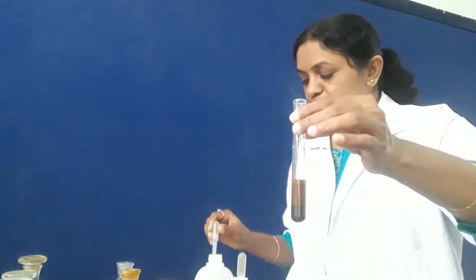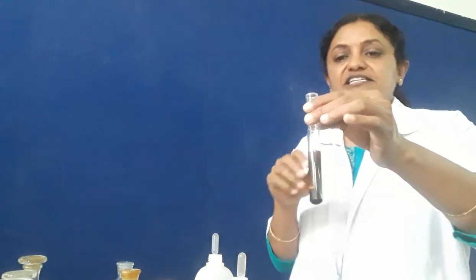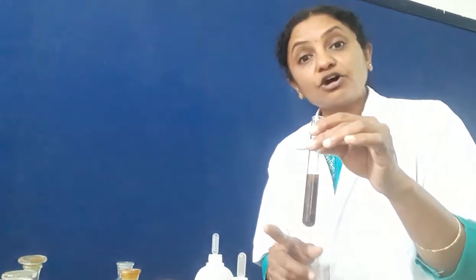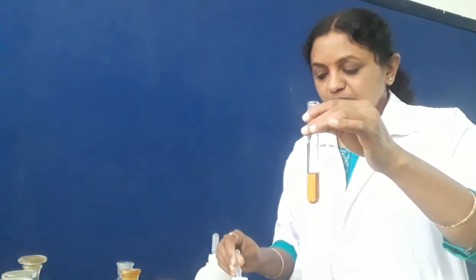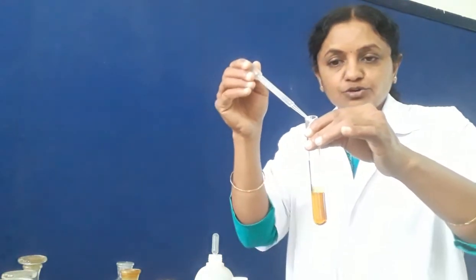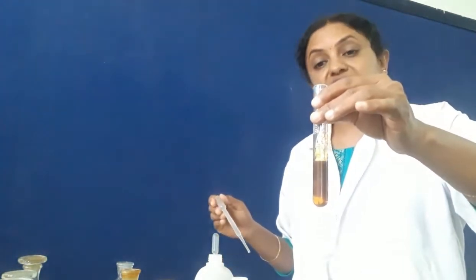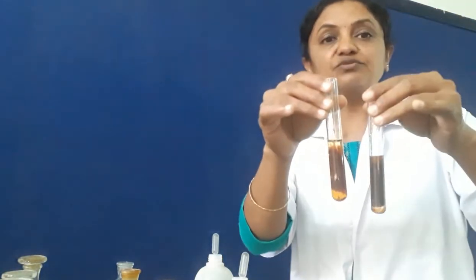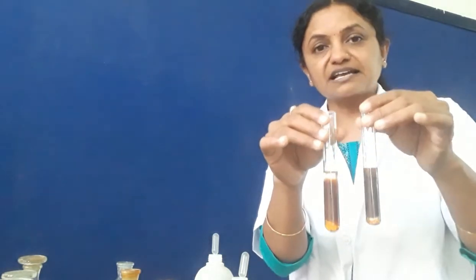On adding excess of sodium hydroxide, the precipitate remains as it is. Note that all these are precipitation reactions — precipitation reaction means the reactants must be in aqueous state and one of the products is insoluble. In the second test tube we add NH4OH: we also get a reddish brown precipitate, insoluble in excess. In both cases reddish brown PPT confirms ferric as the cation.